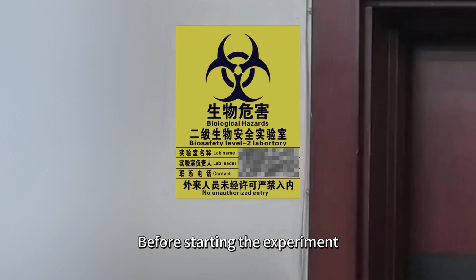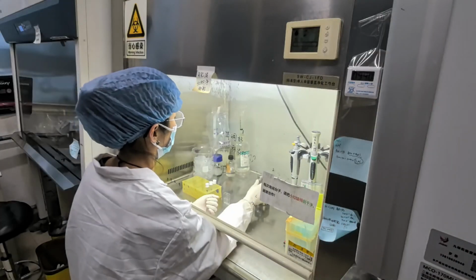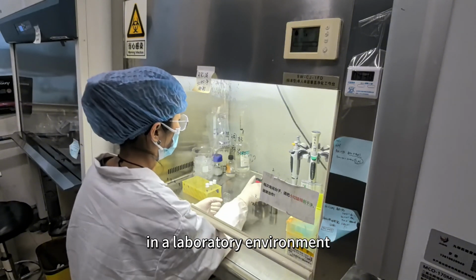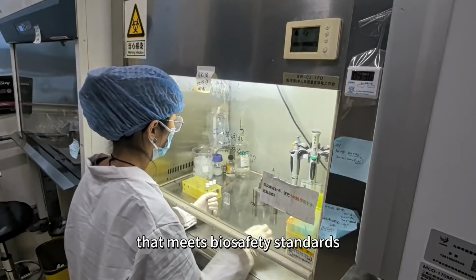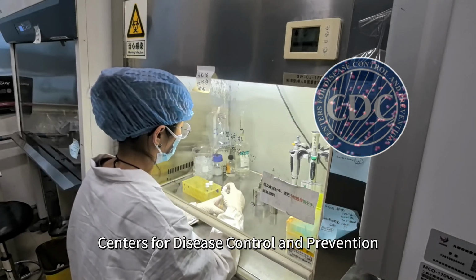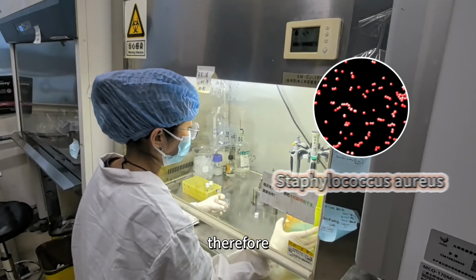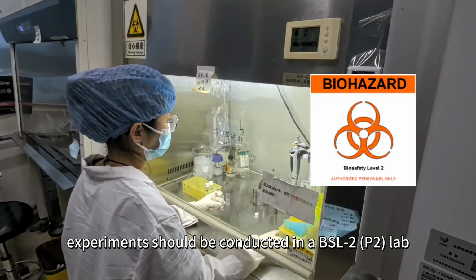Before starting the experiment, it is essential to understand the biosafety level of the bacteria being handled. Ensure the experiment is conducted in a laboratory environment that meets biosafety standards. For example, based on the biosafety levels of the Centers for Disease Control and Prevention, Staphylococcus aureus is a biosafety level 2 pathogen. Therefore, experiments should be conducted in a BSL-2 lab.